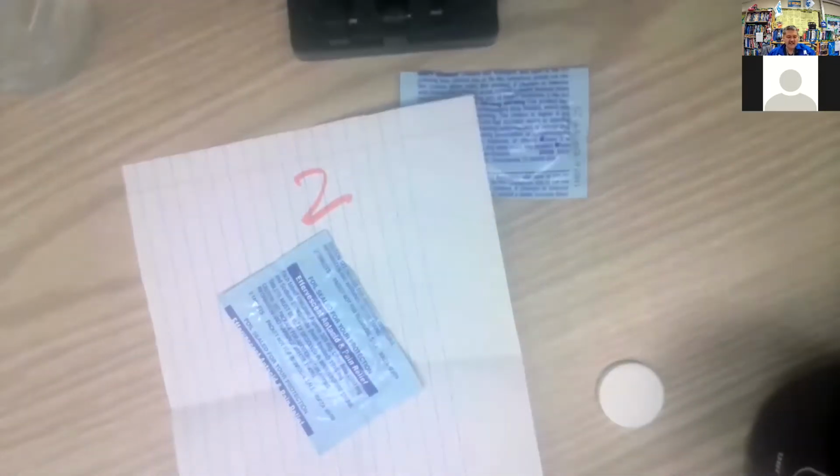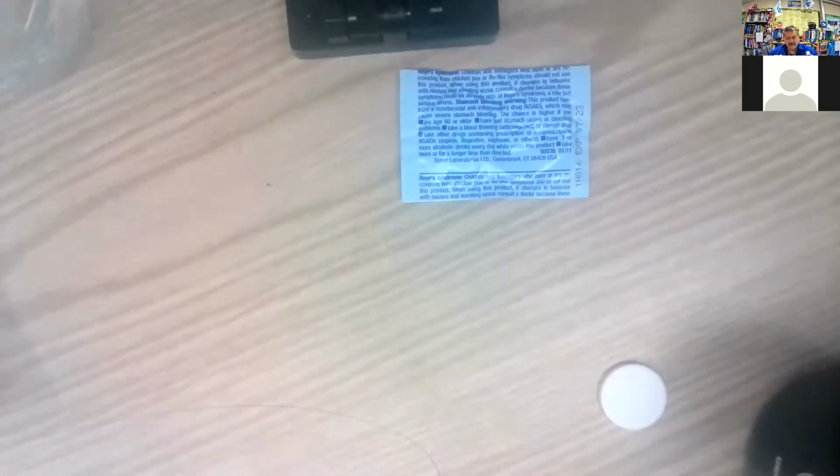So there's one. And so this is my, I'll put this on my 2 paper right there. I might not even need the paper, but I don't know. We'll see. There's a break this. Oh, I did already break it. I can feel it.